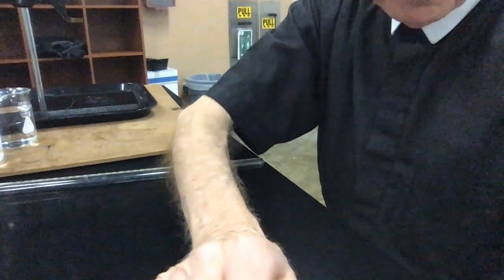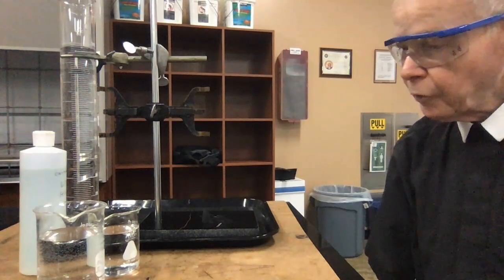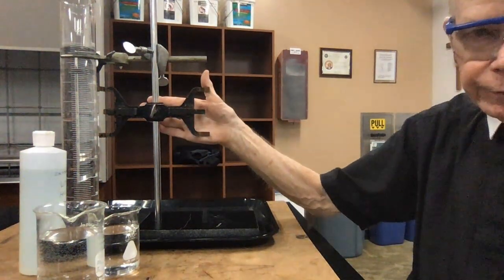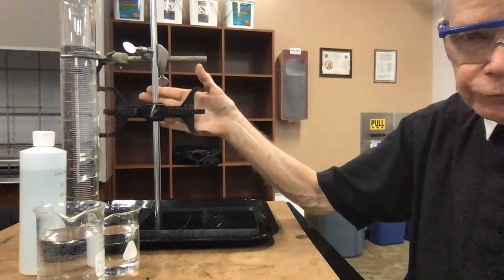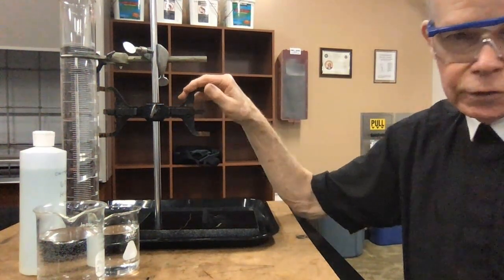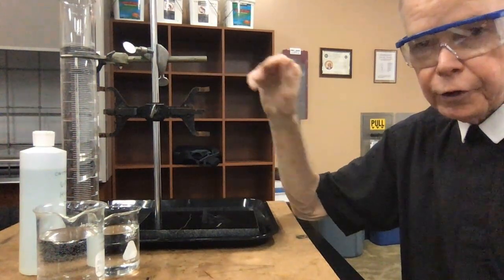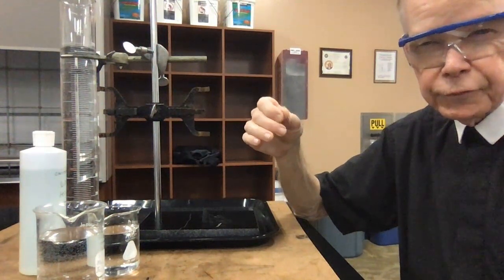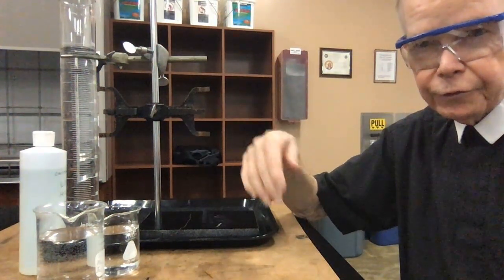Now, I'll stop the computer here momentarily. A couple of other pieces of equipment. On my stand here, I have a special clamp. You might be able to see it. It's a little different from what you maybe have used in the past. It is able to hold test tubes and very large measuring tubes that are narrow in diameter, but they're long.